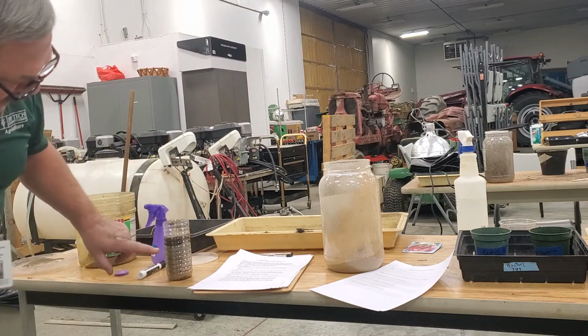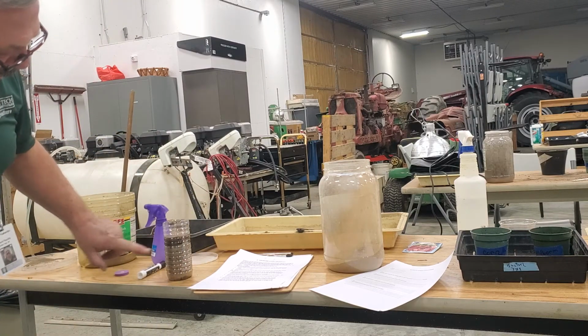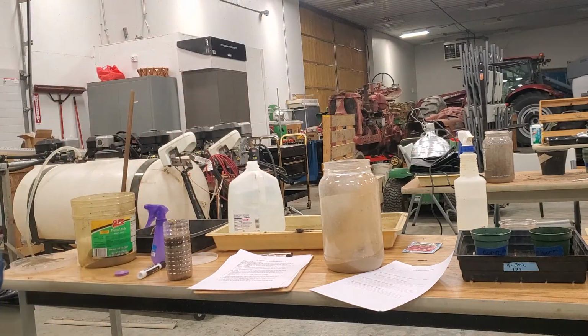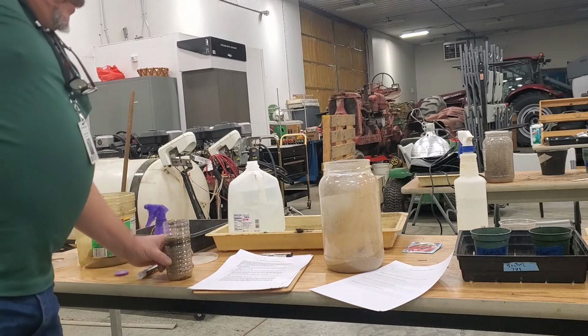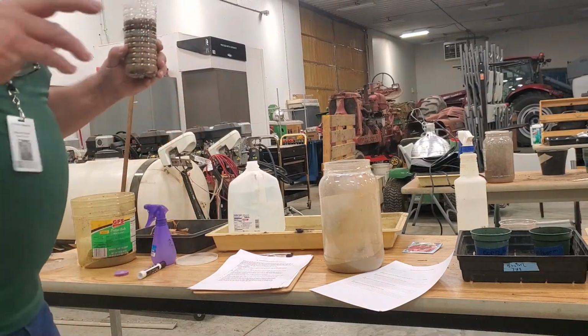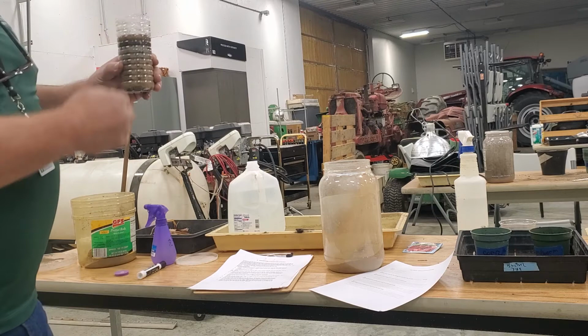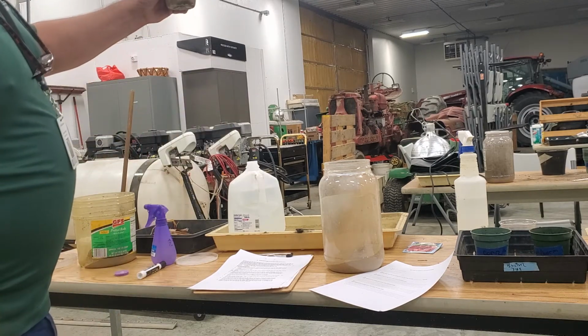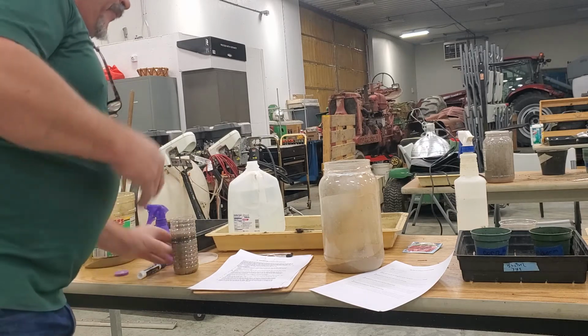And then it starts a wetting front, and I'm going to time that. Okay, so I'm going to look at my clock here. The time is basically 2:45. So it'll probably be after the video is over, but I'm going to keep track of that, and the next time we come back I'll give you the data there. But that's got a wetting front that's going down through there.